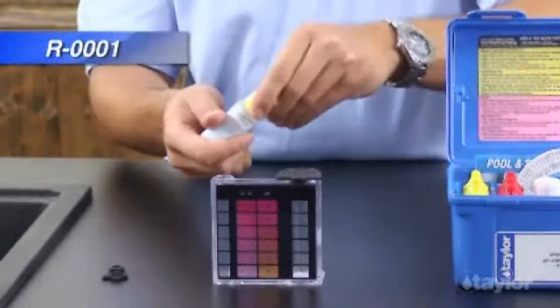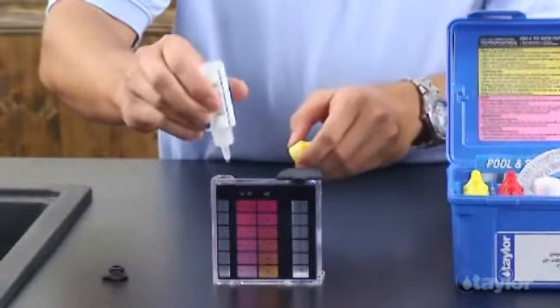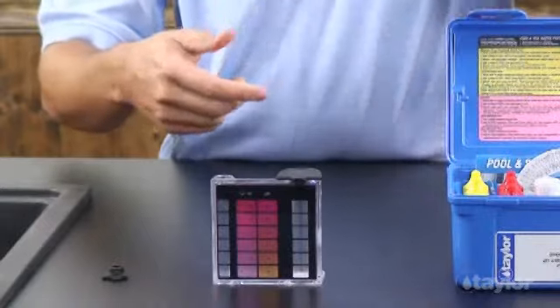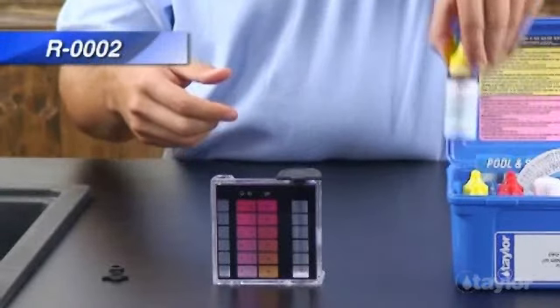Add 5 drops of Reagent 1 and 5 drops of Reagent 2.